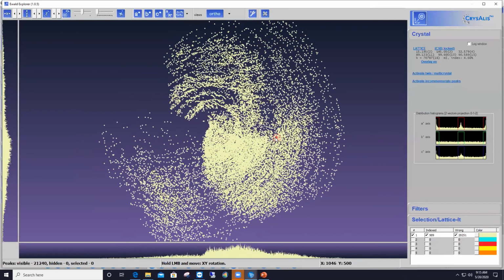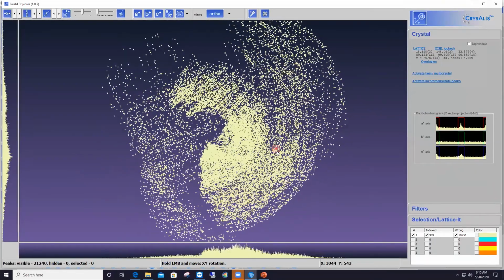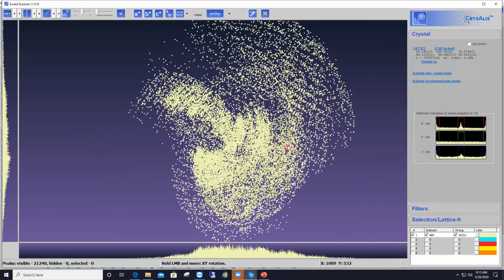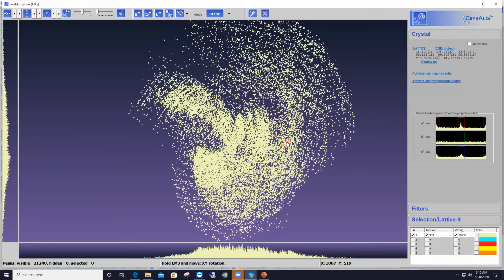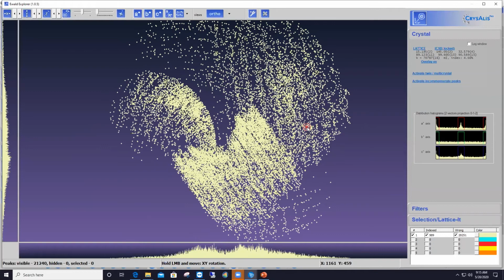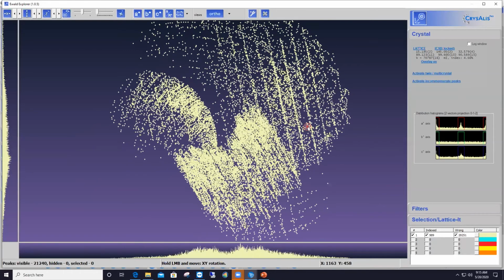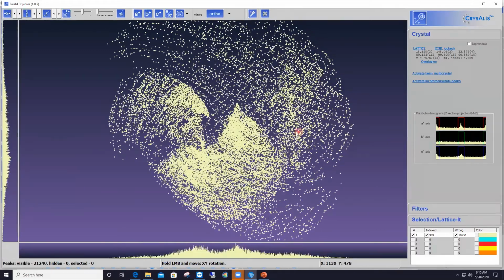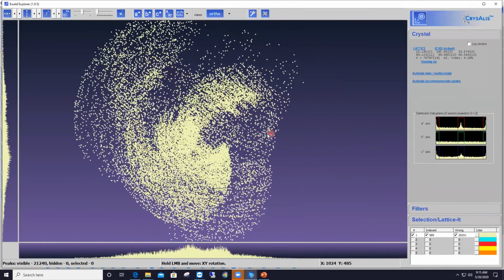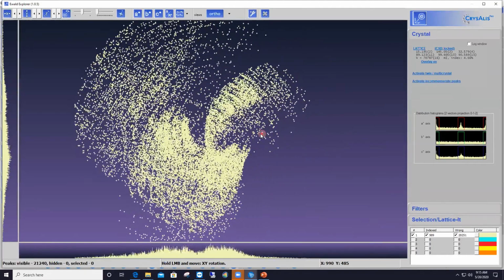So basically, with the left mouse, I click and drag, and rotate slowly to see rows of reflections. So you see up here, I can see some rows already. They might not be too obvious, so I'm going to rotate some more. Here is another orientation where I've got rows also, okay? And if I keep rotating, in this case, I'm rotating in the horizontal direction. I just chose that direction as such. Do I have something more here?